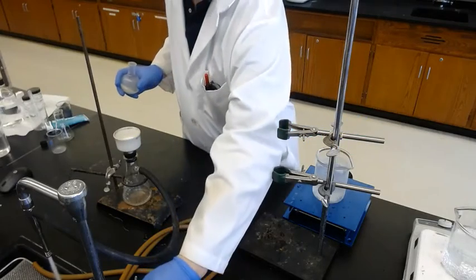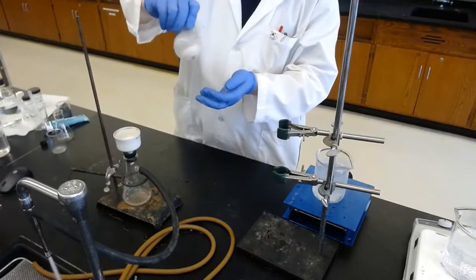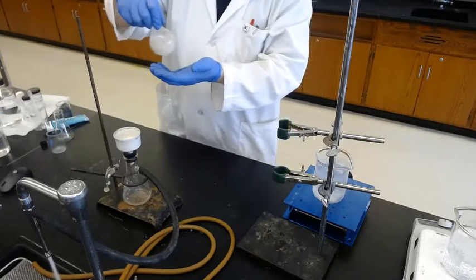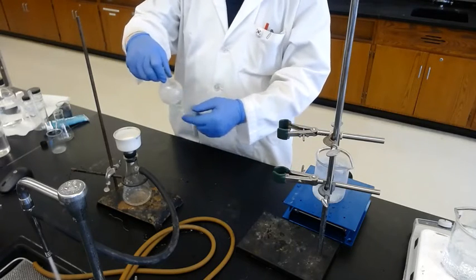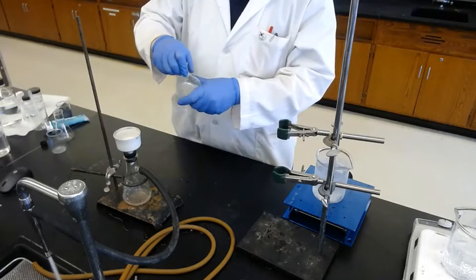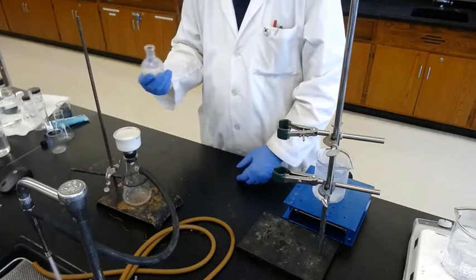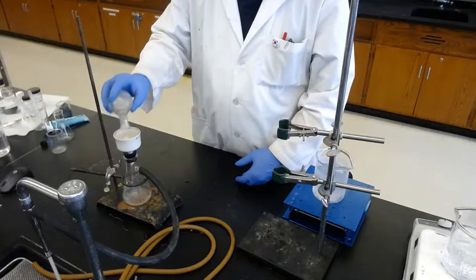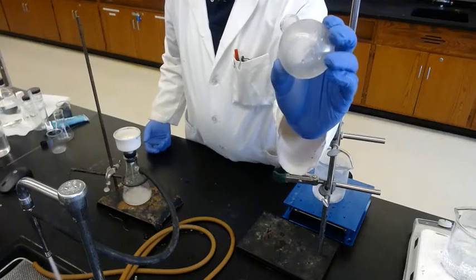And also make sure the vacuum is on all the way. Okay, so swirl it a little bit. And maybe you have a tendency to transfer this solution with the solid slowly. But if you transfer slowly, most of the solid remains inside the flask. So you have to go quick but gentle, so no splash. So swirling it. And quick and gentle, transfer all of it. Okay. So this is almost no solid inside. Okay.